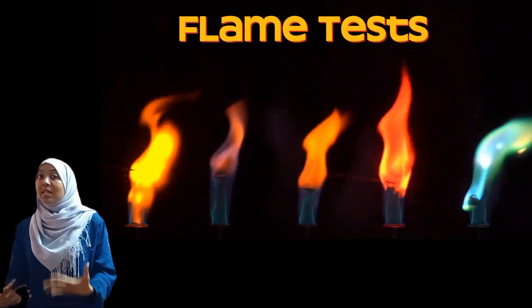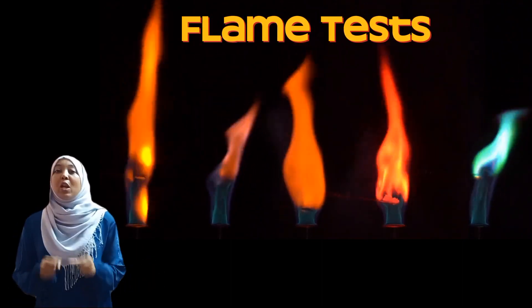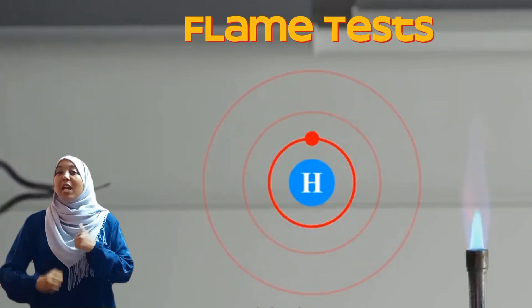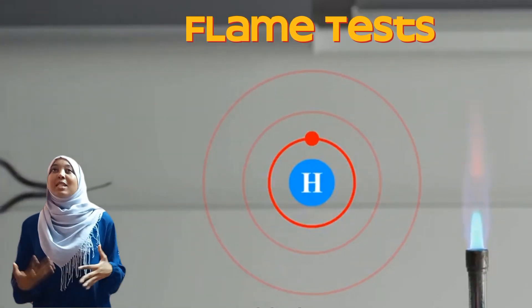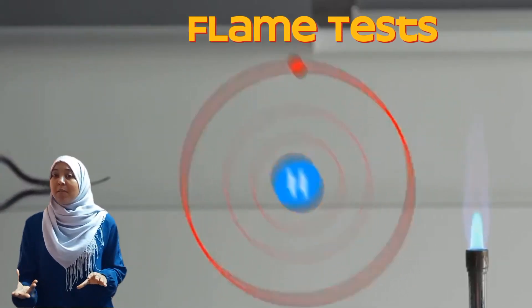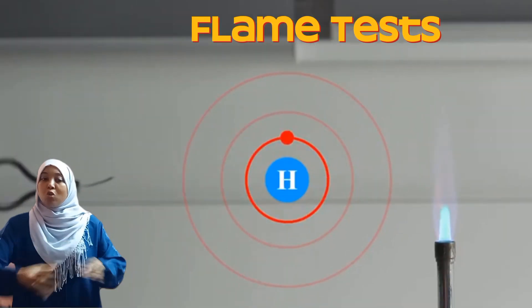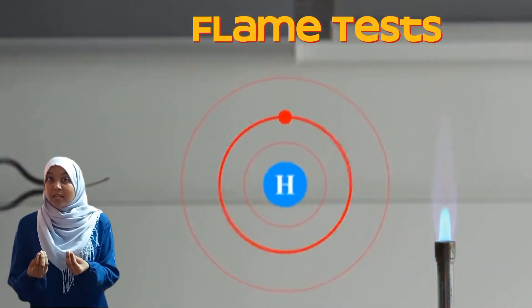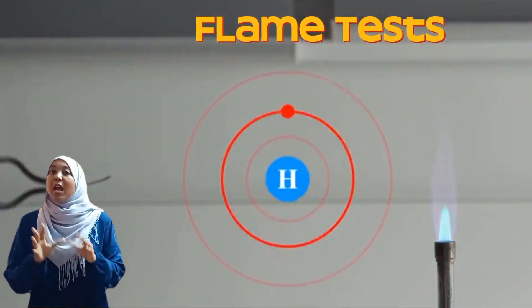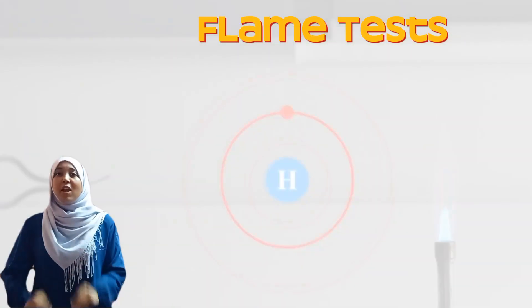You find that the flame color emitted by lithium is going to be different from that of potassium. When you heat a compound, the electrons present within absorb energy and become excited — they move further away from the nucleus. After a little bit of time, they go back to their ground state, their normal positioning, and in the process lose this energy in the form of light. This is the flame color that we see for certain compounds. Every metal ion has a distinctive, unique flame color.